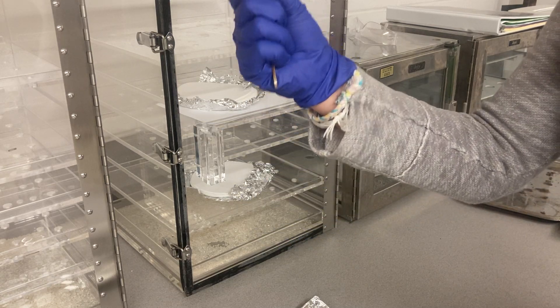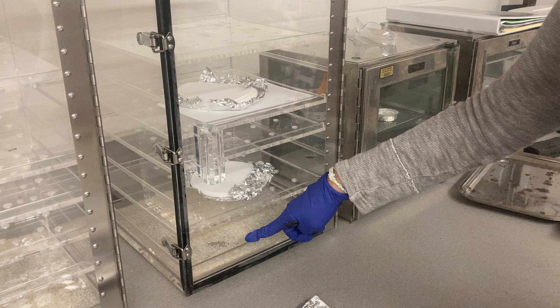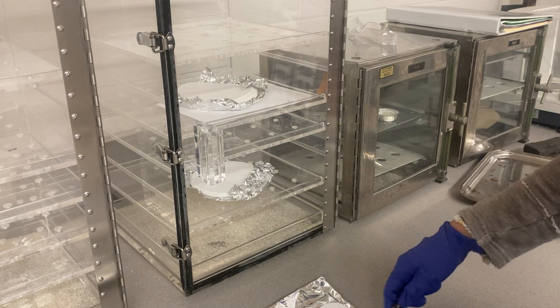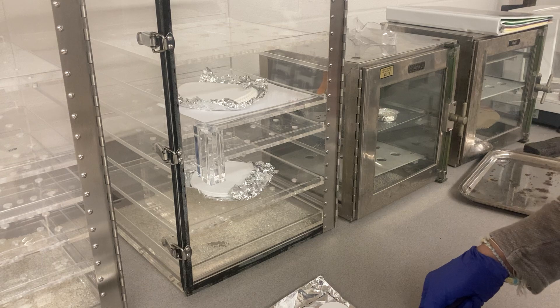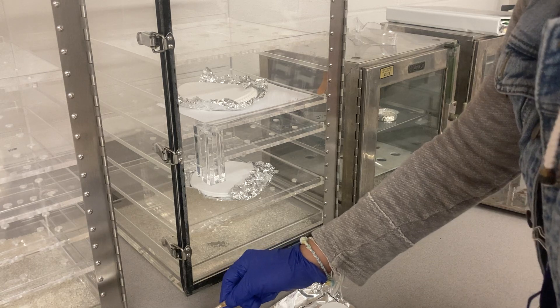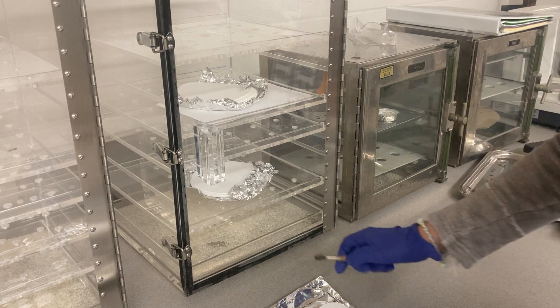The silica gel absorbs moisture — you know silica gel, like when you eat seaweed or something, it's the packet that keeps the product or food crunchy. So the water goes to the silica gel and not back to the filter or your sample. You have to use tweezers — do not use your hand. You have nine samples: three samples in triplicate.